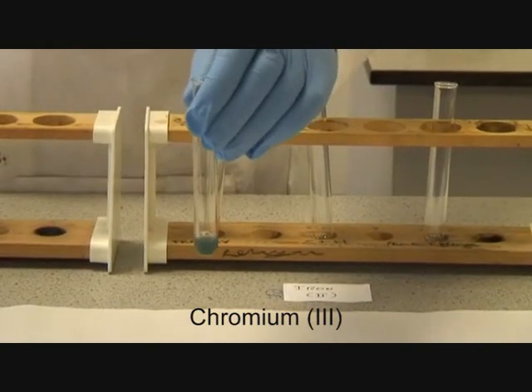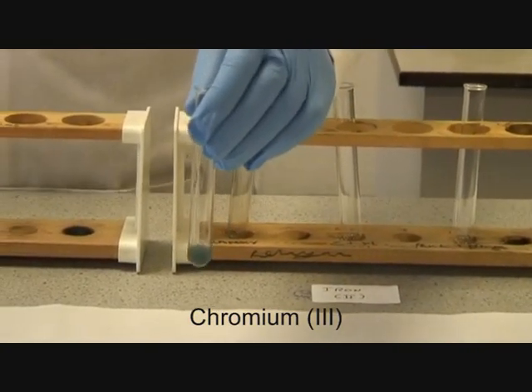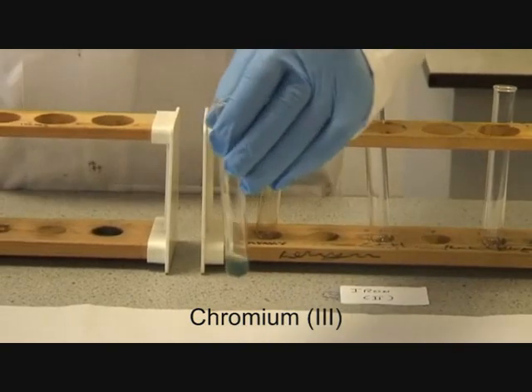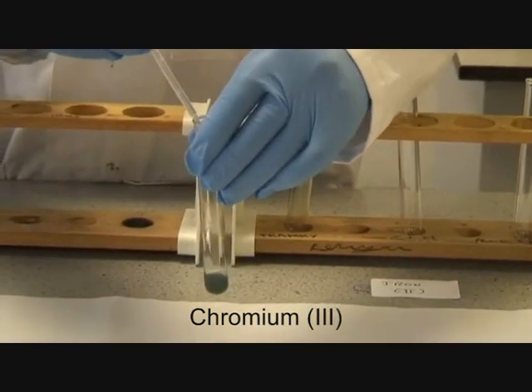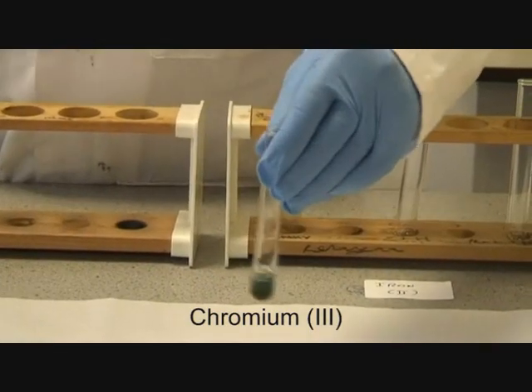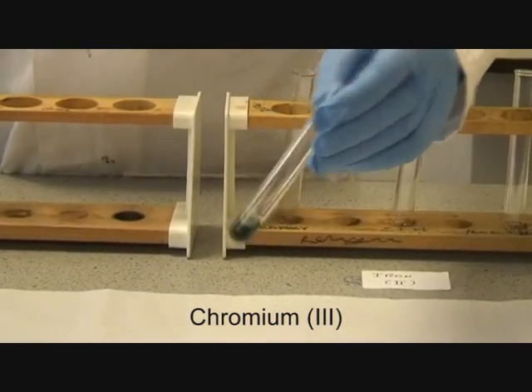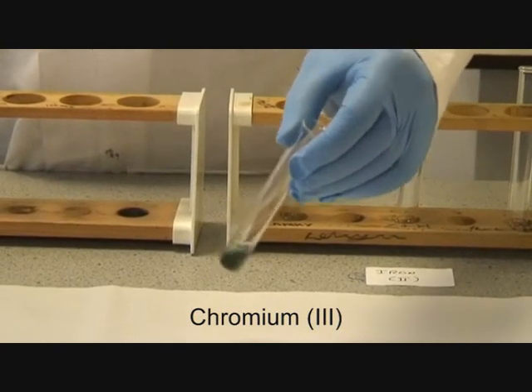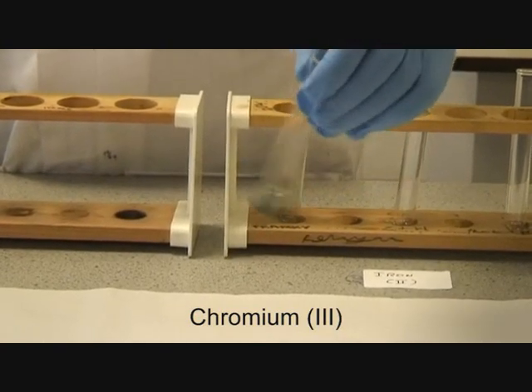We're now going to add to this an excess of sodium hydroxide and observe what happens. You should have observed that the solution has clarified, and we've got a deep green solution. Again, you must try to identify this species.